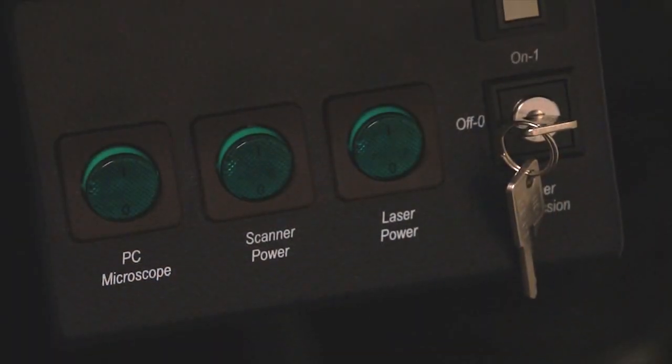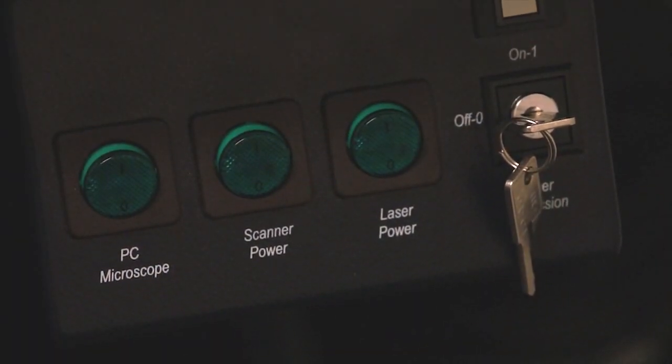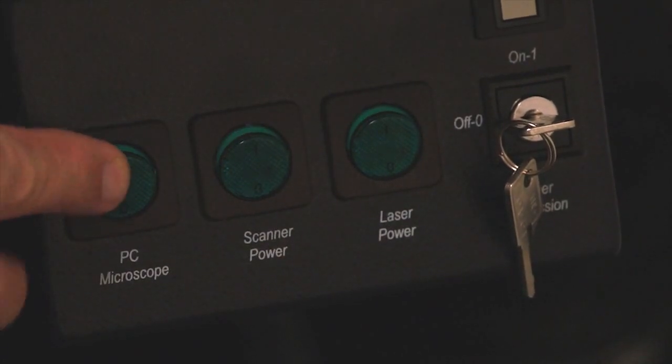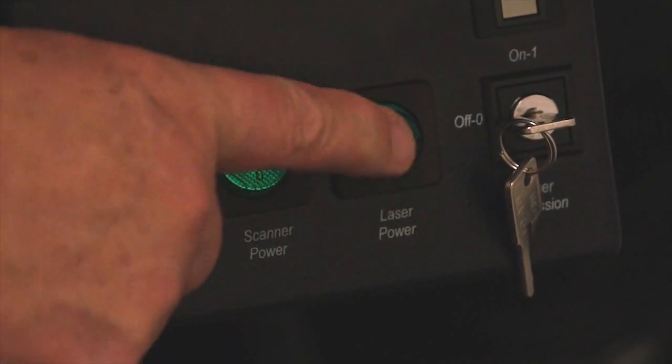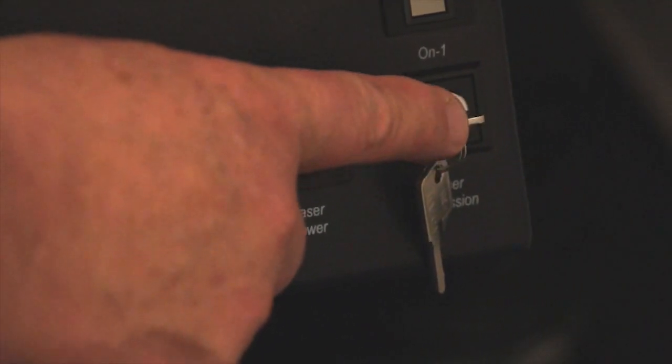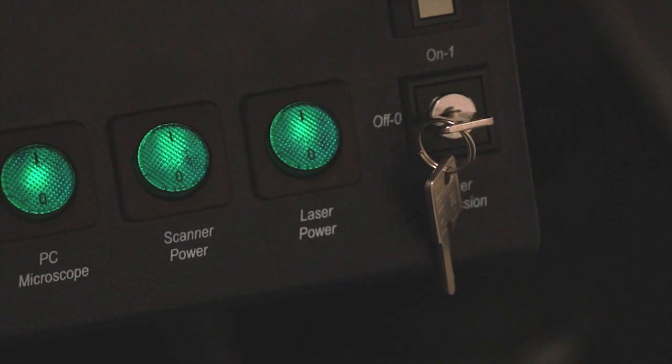To initialize the confocal microscope, you must first apply power to the microscope and to the computer which drives the software. You also would apply power to the lasers, but we will hold off on that until another segment.